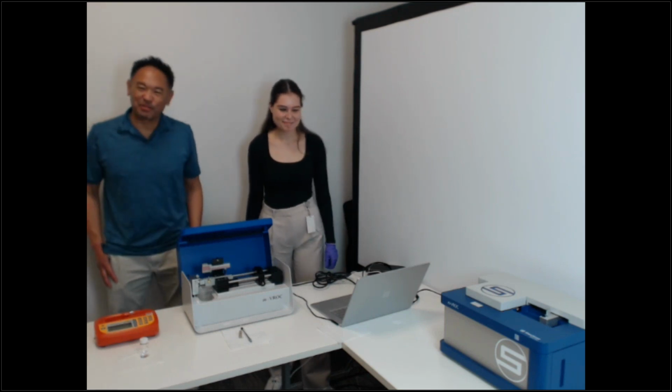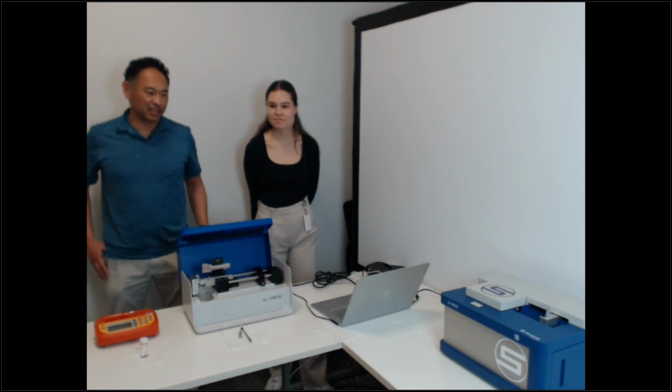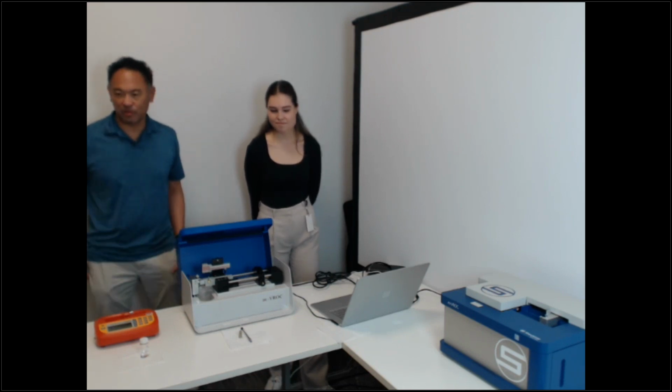Anyway, so today's webinar, we'll be using our three instruments that we have. We have the Microvis, the VROC, and the VROC II. And so what we'll do is we will test samples using the minimum sample volume for each instrument. And we'll show you what kind of data you can get out of it. And so Ashley will go ahead and start with the Microvis.